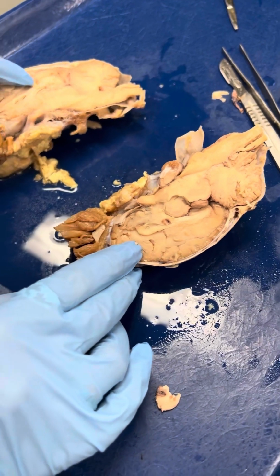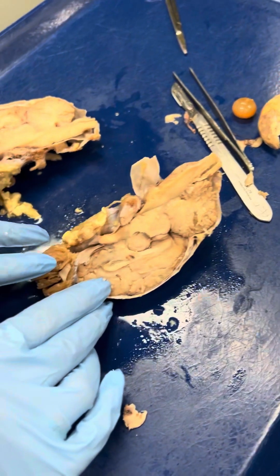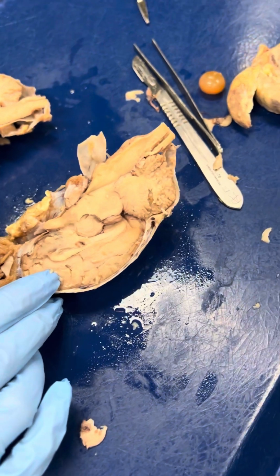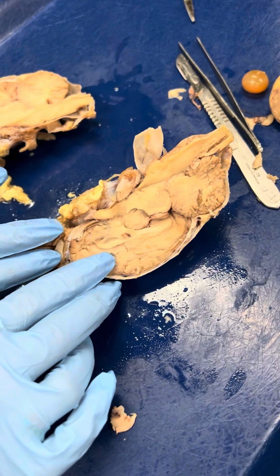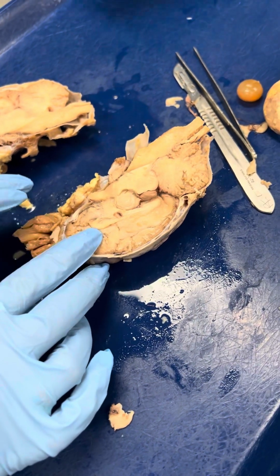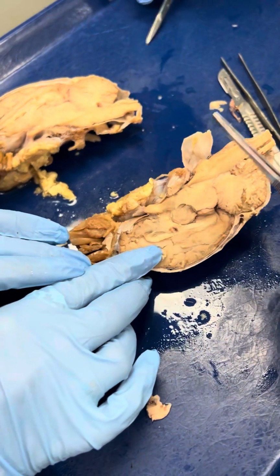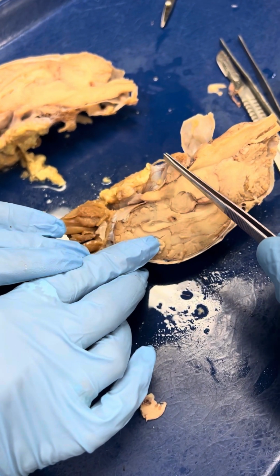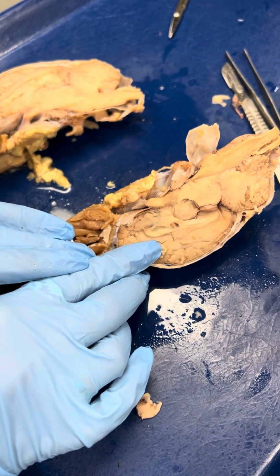The hypothalamus would be... It's below the thalamus. Yeah, it should be. We just wanted to see what other structures are on that list. Yeah, you don't need to know. Most of the things on here you wouldn't need to know. Or is the hypothalamus under this because this is the optic? I think your hypothalamus is right here. So the pituitary gland will sit right below this, but you don't see the pituitary gland in most of these sheep brains. Yeah. Okay.